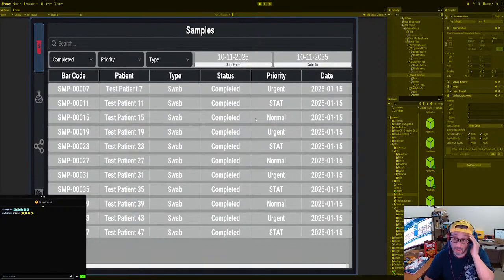Okay, so I made the sample script. If I don't get anything from the database, which might be down, right? To do sample data. The reason I did that is when we actually port this to WebGL, if something happens to my database for some reason, the investor's not gonna like it, and he's gonna say, "Oh, this thing sucks. I'm not gonna invest money into it." I expect perfection. So if we do that, we always have some sort of data, so we always look good. All right, that makes sense, right?